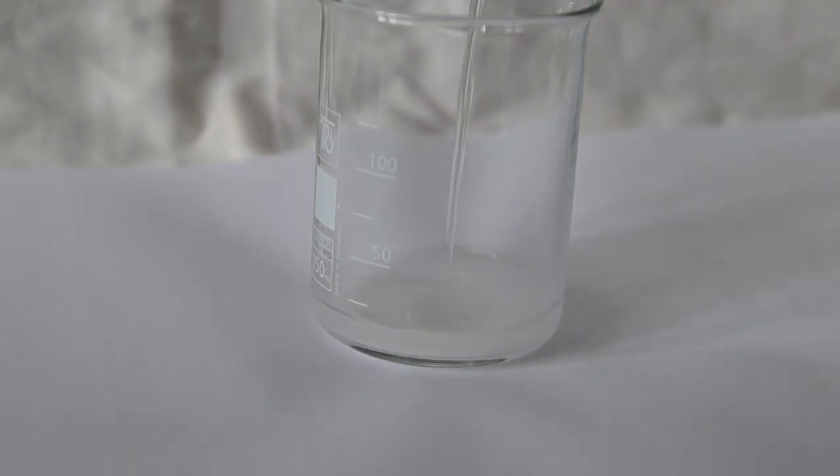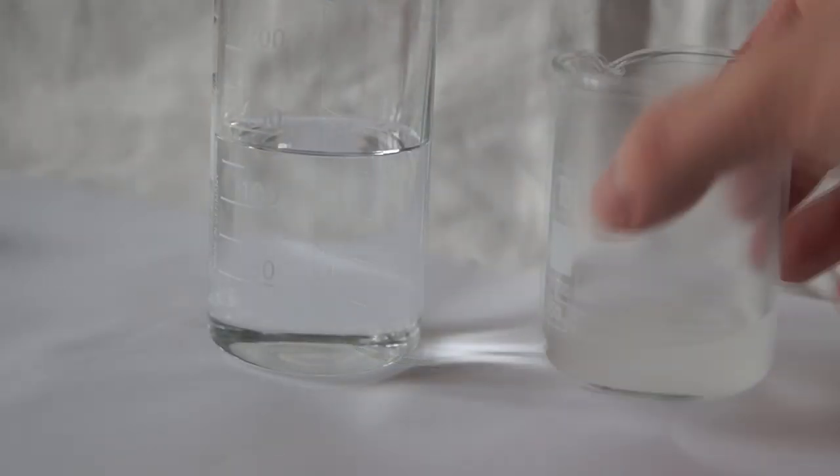Next fill the beaker with boiling water and that should follow with the starch being dissolved. And we will get so called starch paste.